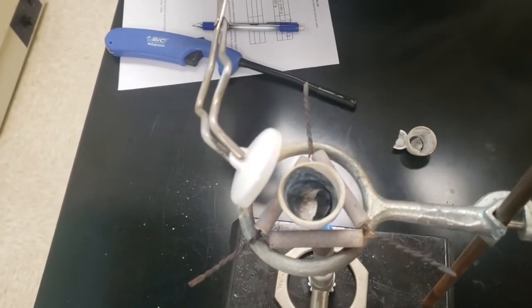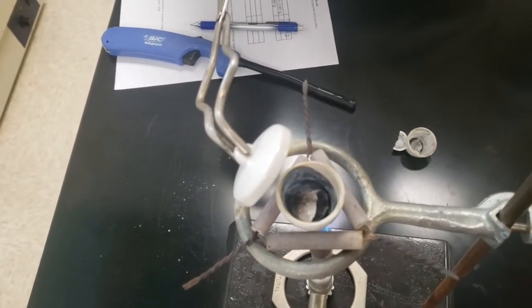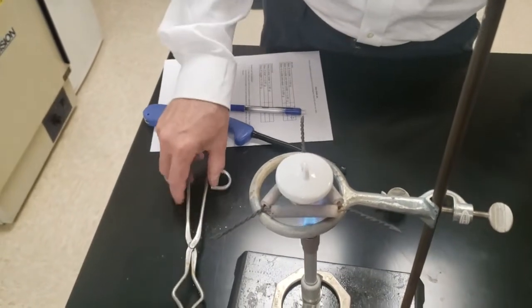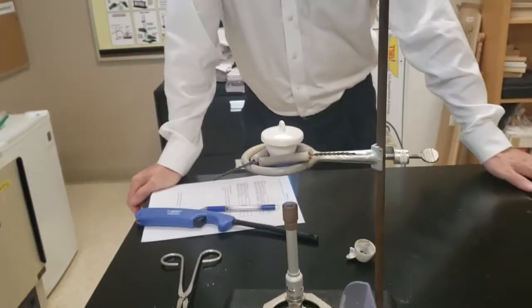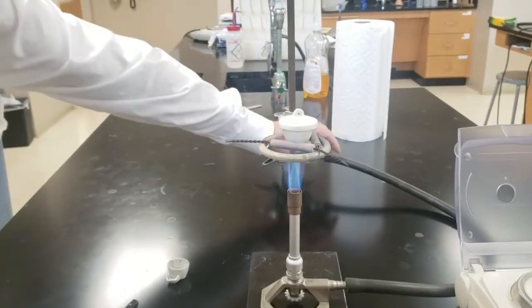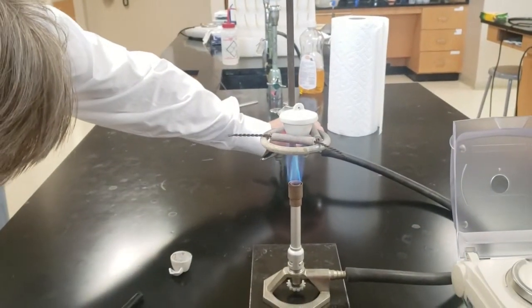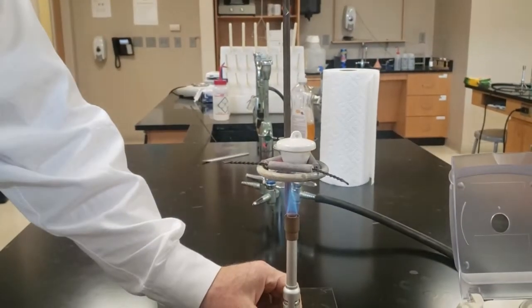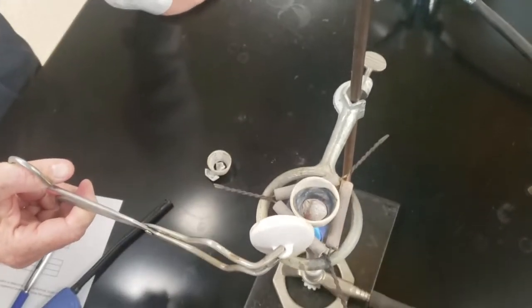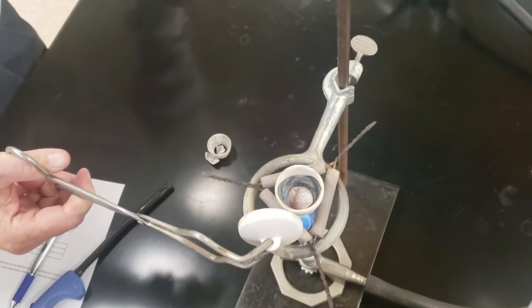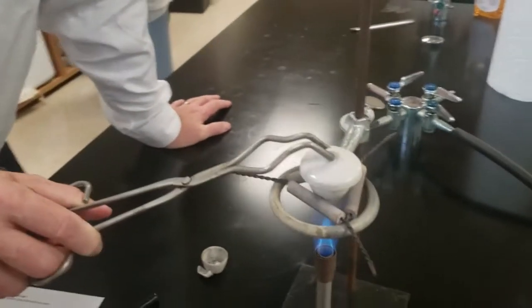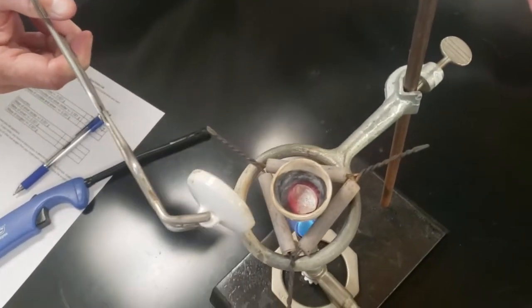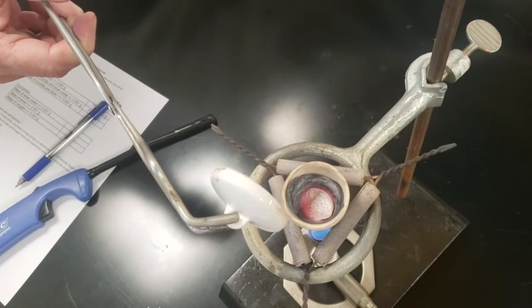You can see a bit that's going on inside. Again, these crucibles can get to be quite hot. This one will be cherry red. And now we wait. I'm getting it just right so I get nice super hot. You see that glowing on the bottom? This is the point at which you don't want your crucible to fall apart. See how red it is at the bottom? We want this to be hot, hot, hot.